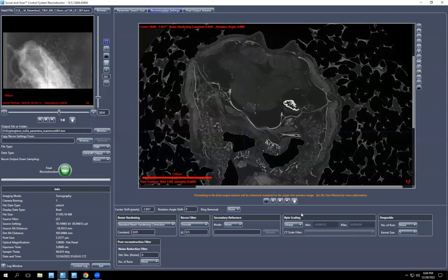Right. You have to change byte scaling here from global to custom and use those numbers you just found. Then you should double check before you do anything that your beam hardening correction stays at 0.05, the recon filter stays at 0.5, and the center shift should be that value that you found earlier. Everything else stays the same. We don't bother with despeckle or secondary reference. So you're ready to reconstruct, and all you have to do is hit start, and it takes about 20 minutes.